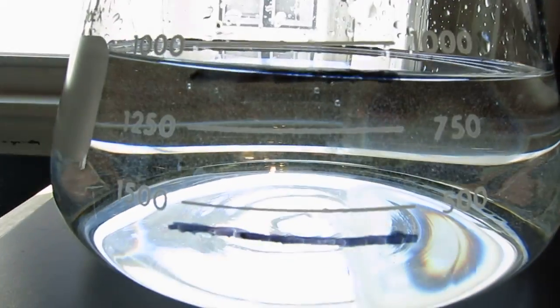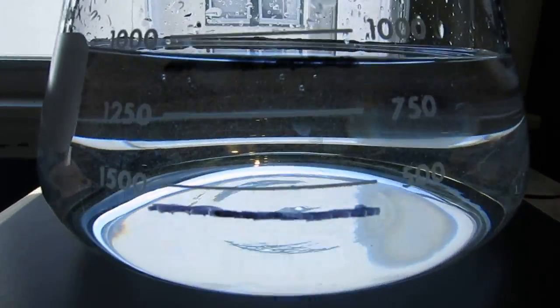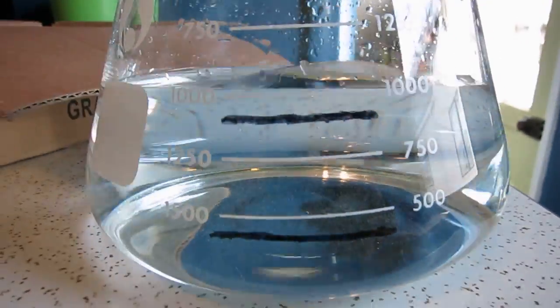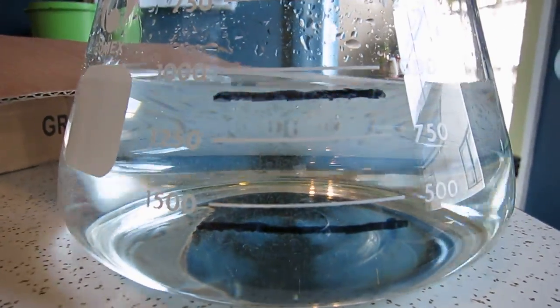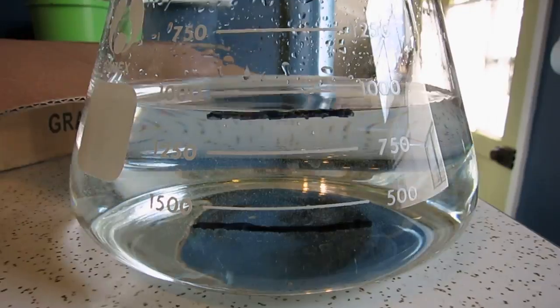So now I just went over. Anyway, the point is, the amount from using two of these 500 milliliter amounts is about accurate. It is kind of hard to see with this light. Maybe I'll move this. The black line is my marker line. The white line is the one that came on. Of course, now it's wiggly all over.